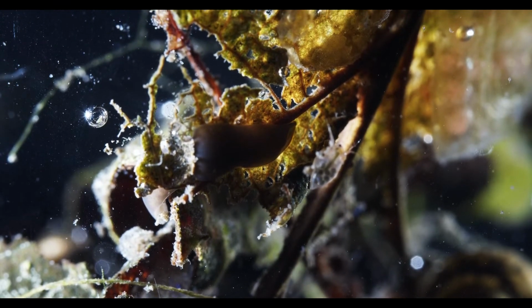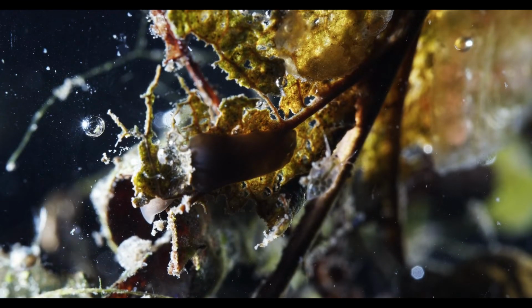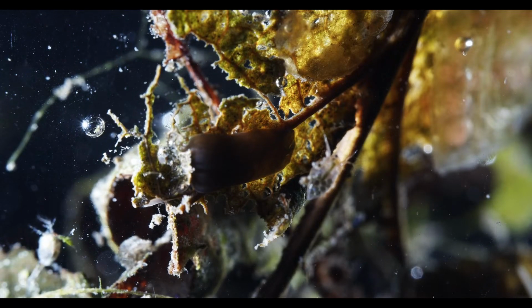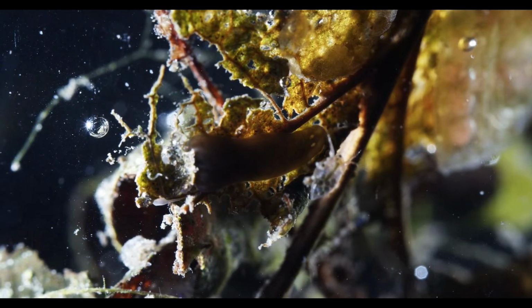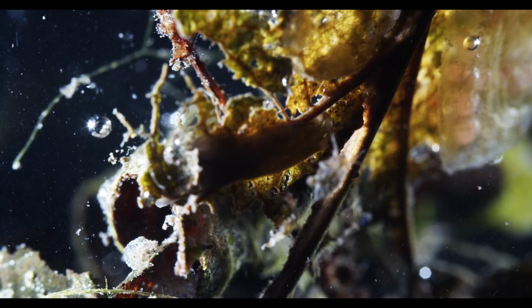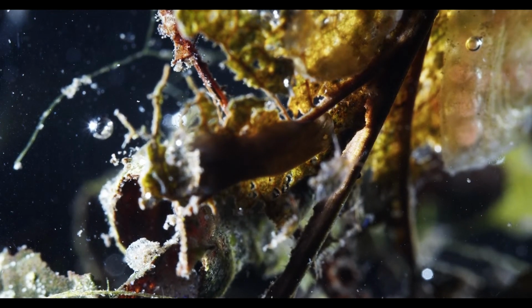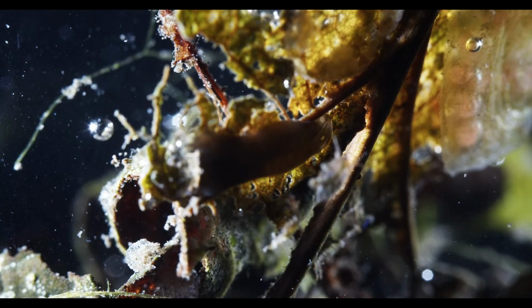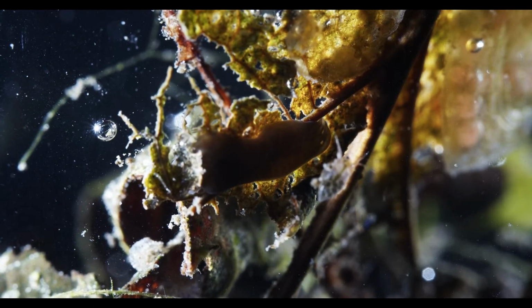Yeah, there's so much to discover in the micro world. You don't have to tell me that. I already nerded out and built this thing to observe the micro world, because I come from bird watching, and for bird watching you can sit in a hide for half a day and basically just see a few robins and blue tits or something like that.